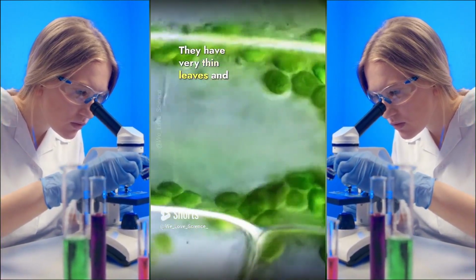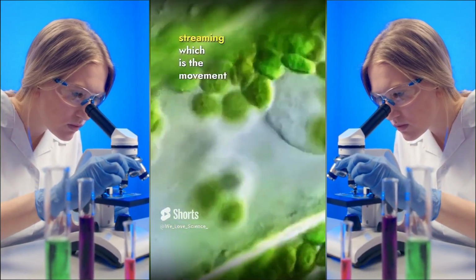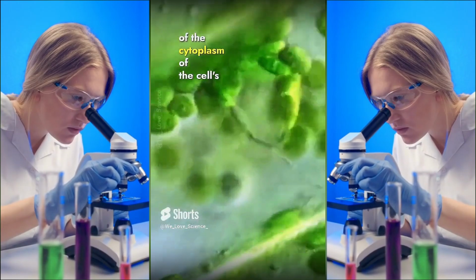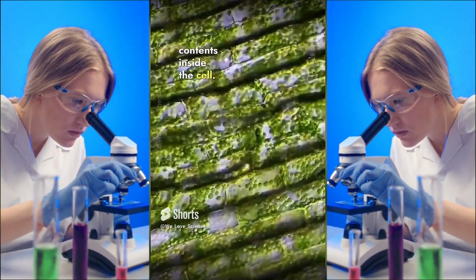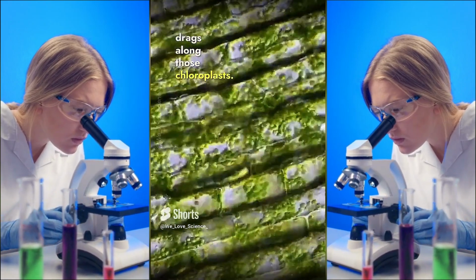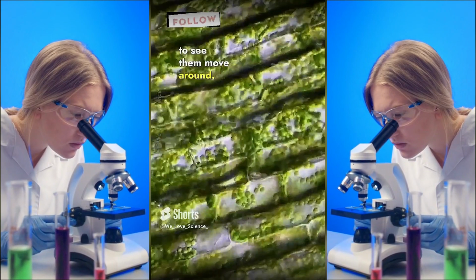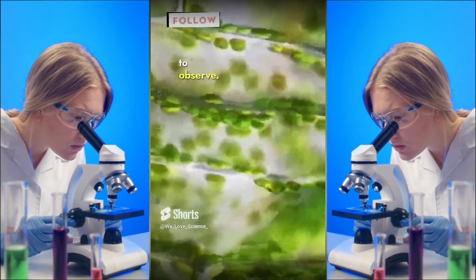They have very thin leaves, and therefore when you put them under the microscope you are able to see cytoplasmic streaming, which is the movement of the cytoplasm of the cell's contents inside the cell. And the cytoplasm also pulls and drags along those chloroplasts. And in time-lapse you're able to see them move around. It was very fun and interesting to observe.